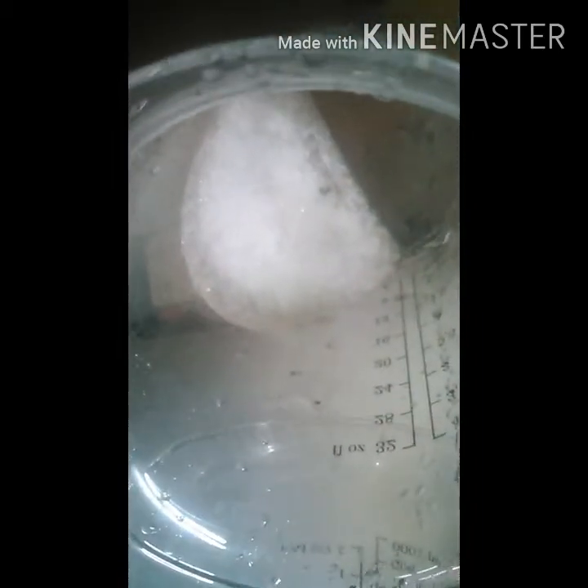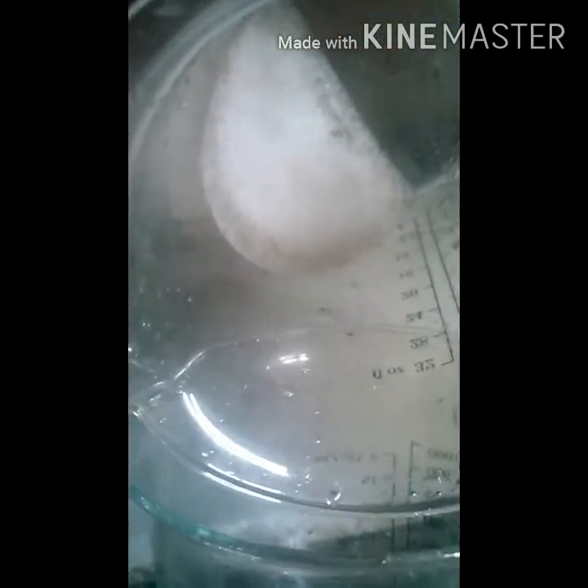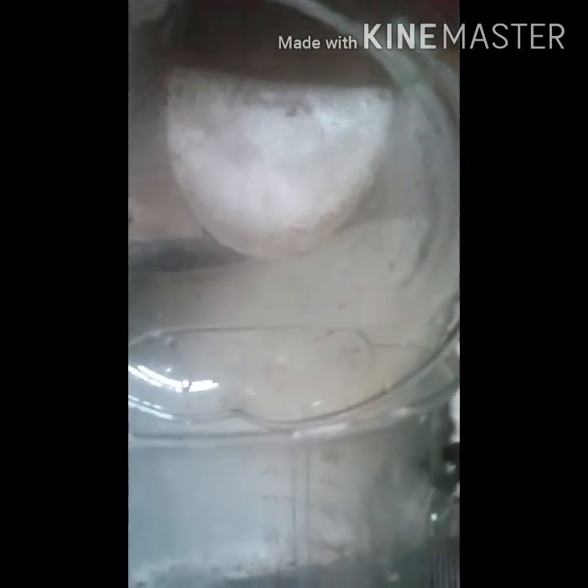There's what I decanted off and there's my finished product. I still need to dry it, but that's it right there — it's nice and clear and once it's dried it'll be all good to go. I'm going to probably just stick it on my vacuum pump, suck it dry, and then let it air dry for a little bit. I don't know if this stuff is hygroscopic or not, so I'll have to figure that out. But anyways, that's all it takes guys — until the next one.